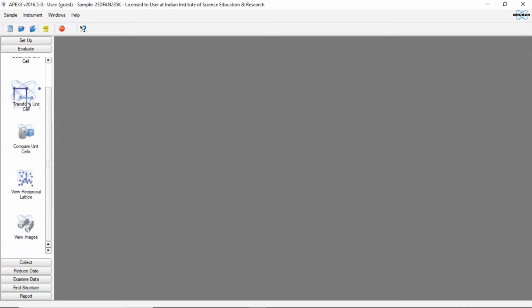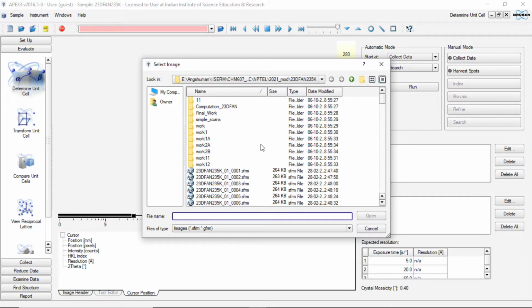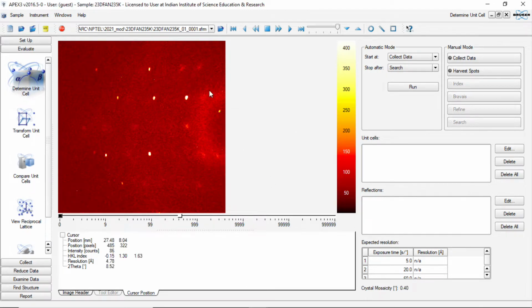So when we try to do this indexing, you will see that this crystal does not give any specific unit cell parameter, and it gives a very poor fit for indexing this pattern. So I am now just loading the images. When you look at this image, you see that these reflections look like a single crystal. It is not looking like a polycrystalline messy substance.